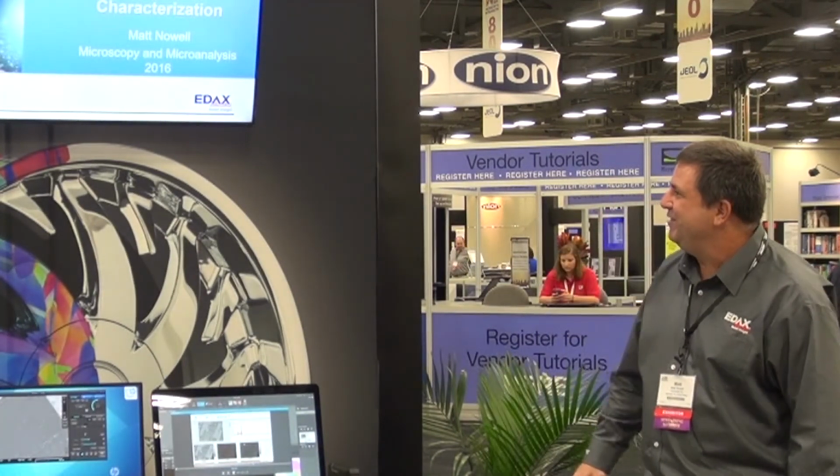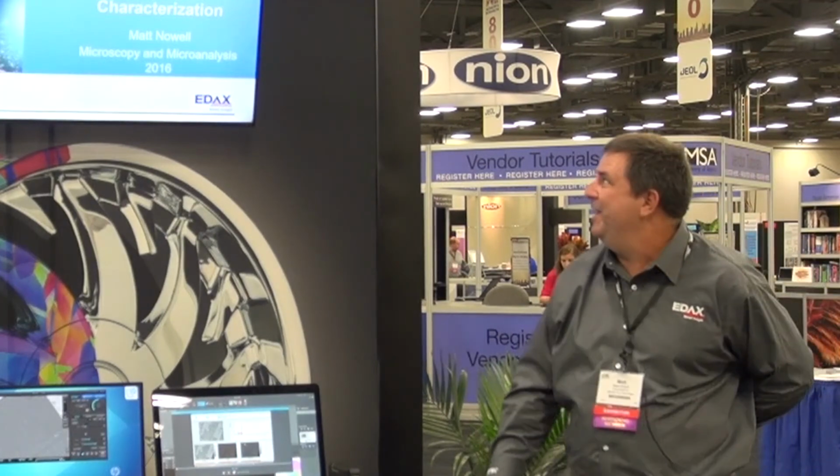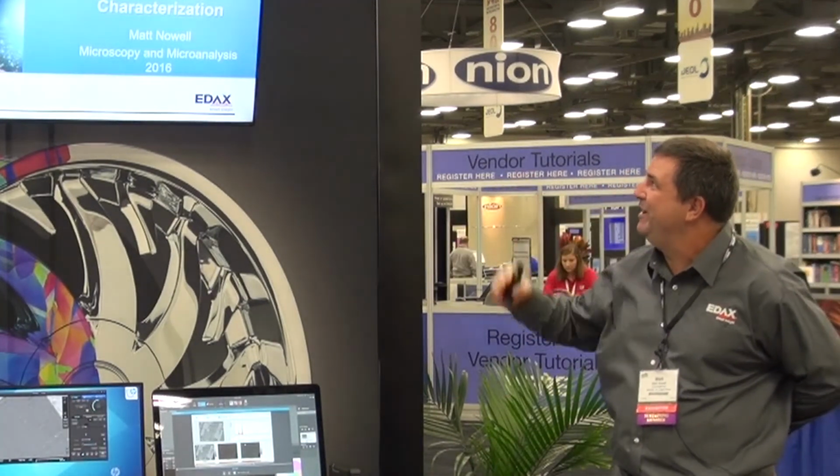My name's Matt Nowell. I'm the EBSD Product Manager here at EDAX. And what I'd like to talk to you today about is a product we call OIM Analysis. And so the title is What's New, what it can do, and how you can improve your materials characterization.